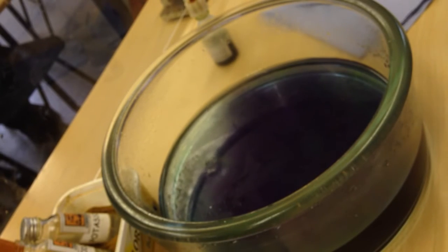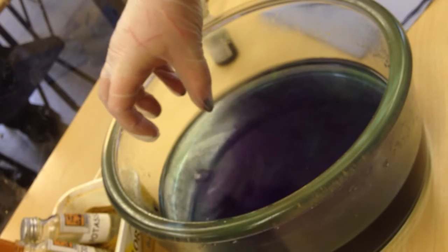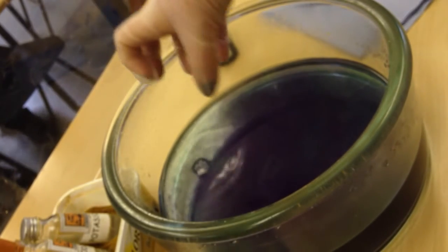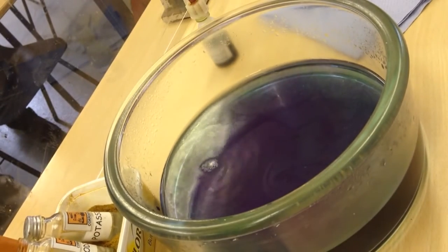Right, here we go. It's starting to bubble, so if we're quiet we might be able to hear it fizzing. Very quiet, we might be able to hear it fizzing. Now what you can do with this, I don't have one here, is get a test tube.